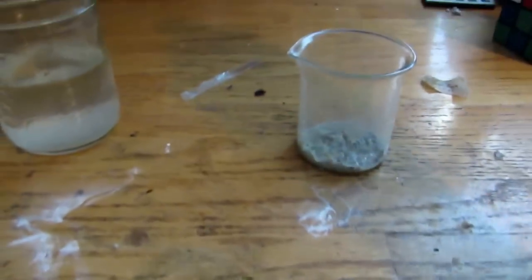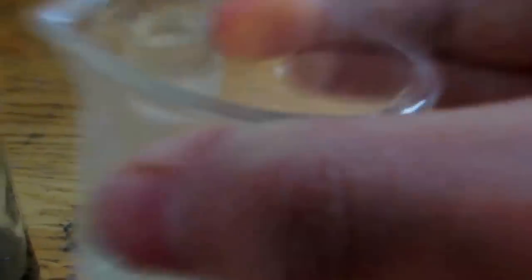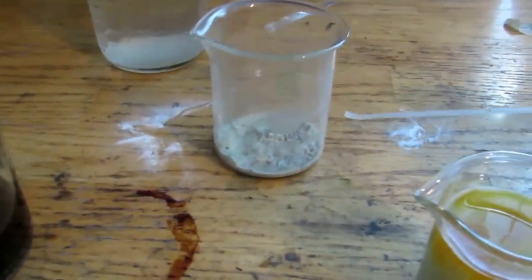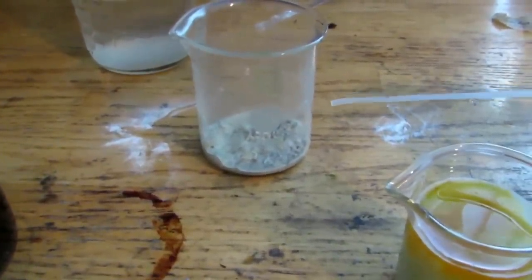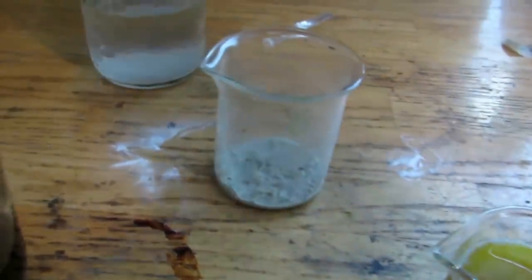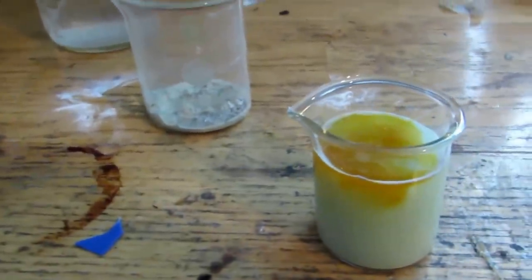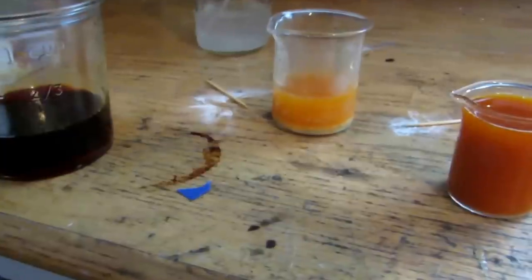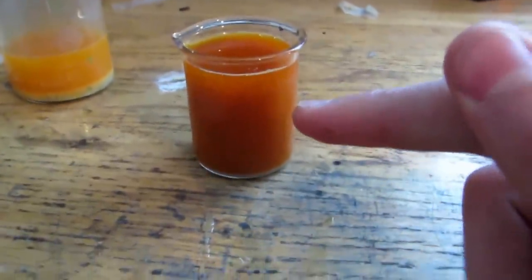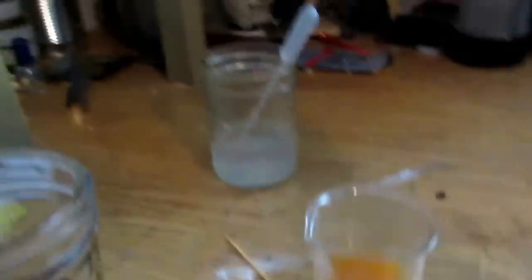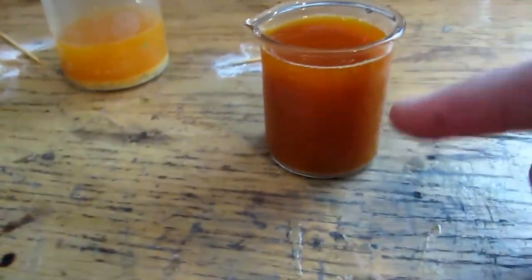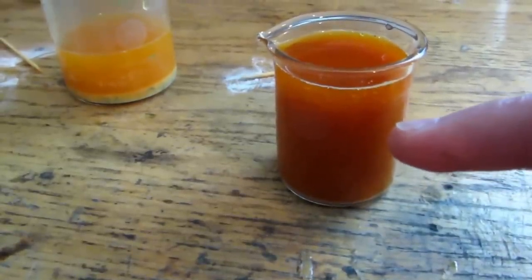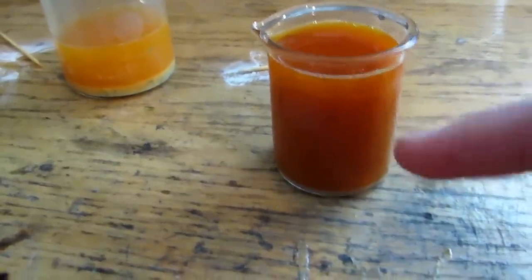So, you're going to be saving this, and then here is our final product of all of those little monolithic ceramic capacitors. So, I'm going to fill this with about, probably about three-eighths of the way full with hydrochloric acid, then we're going to be dropping in some nitric acid. So, I'll be back in a moment, and I'll show you all the processes that we're going to be using to get out the palladium from this. Okay, so I added a bunch of nitric acid to this one, and probably just a couple of pipettes full of it, and you can see it's dissolved quite nicely, and you may have this deep red color. This is definitely palladium chloride, I believe, which is in solution here.